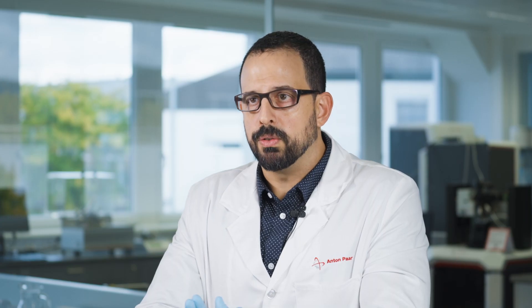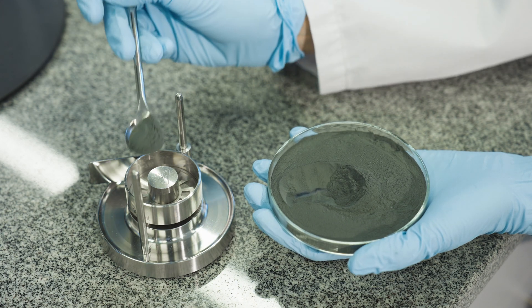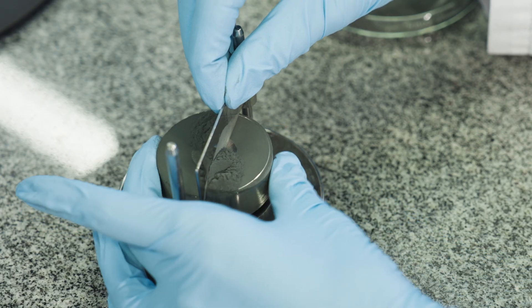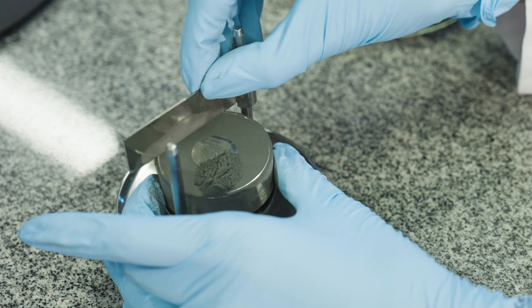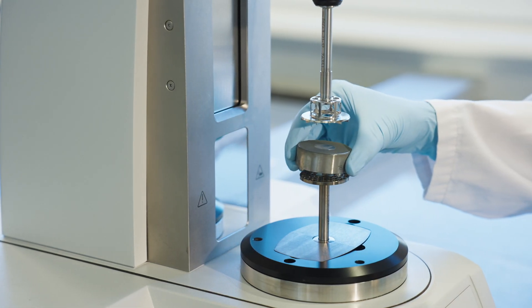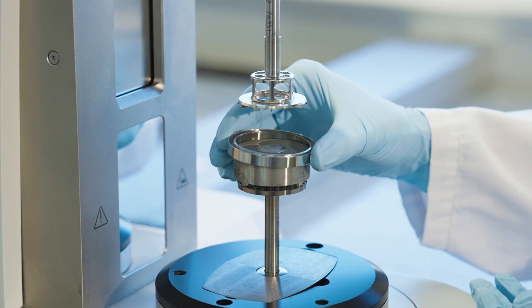This is basically the instrument calibrating itself prior to the analysis. At this point, you are ready to fill the cell with a powder sample and make sure it is uniform and evenly distributed with the use of a sample preparation bench. Place the cell and the overflow ring.